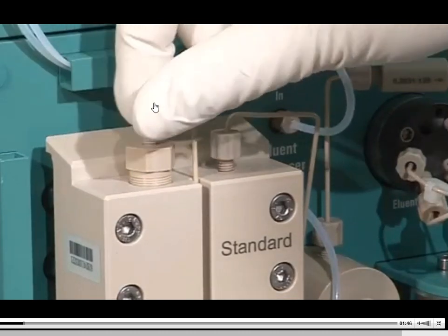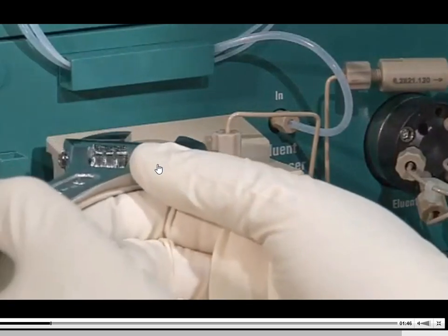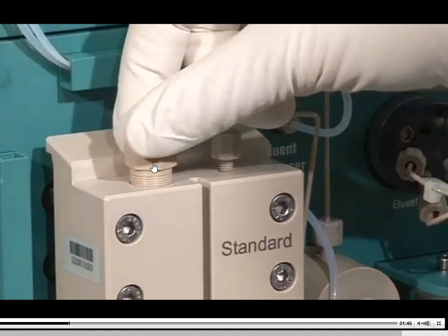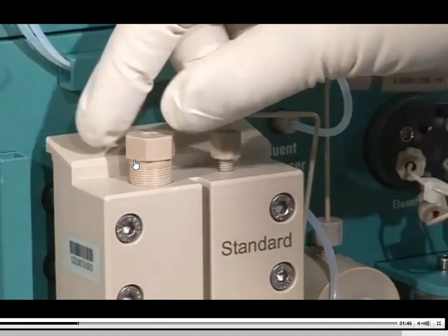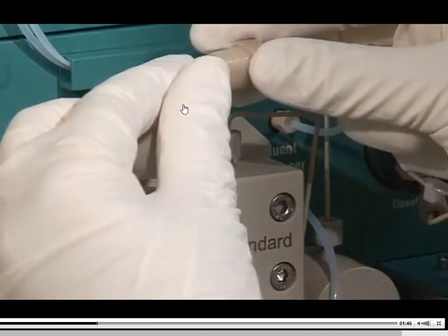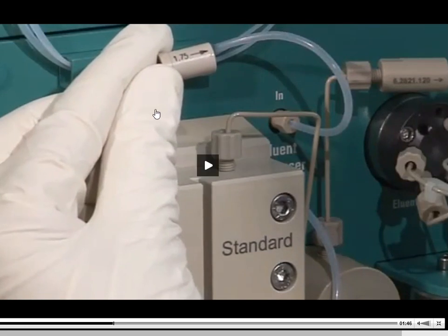So this piece is going to get screwed off. The inlet and outlet valve is this big piece here, this big nut looking thing that you're seeing right there. This thing just gets tightened up with a wrench. You just unscrew it out of there. And there's going to be what I would call an interior filter in a way. So this piece is going to be popped off, and that little piece there in the center is going to slide out. There's going to be an area here that needs to be cleaned. If you've got some gunk buildup, either in your sample or your mobile phase, what you're going to see happen is that this piece can get gunked up.